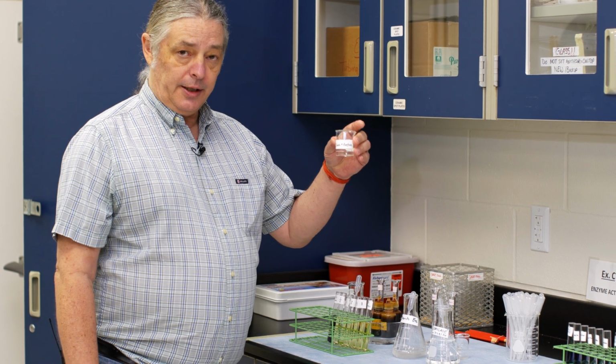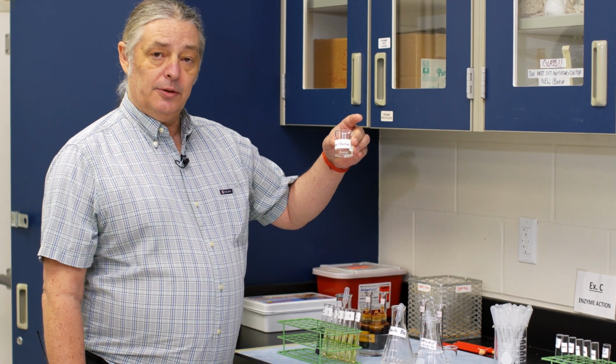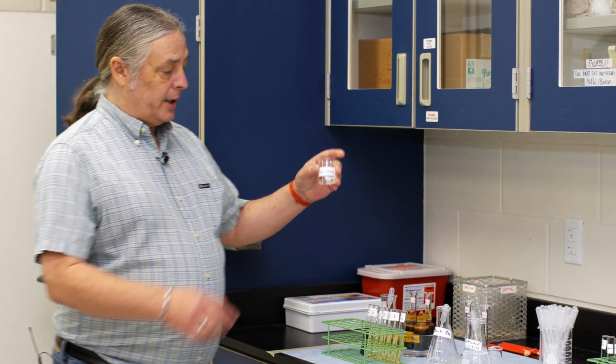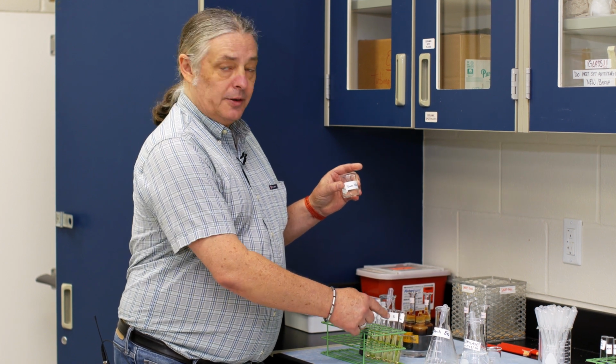When we get the starch and amylase solution ready to go, we're going to be timing how long we've allowed the amylase to potentially do its thing, and at each time increment, we're going to take a sample from this starch and amylase solution and add it to each one of these test tubes that represent the different time steps that we want to check, to see if that enzyme activity has happened and to what degree.